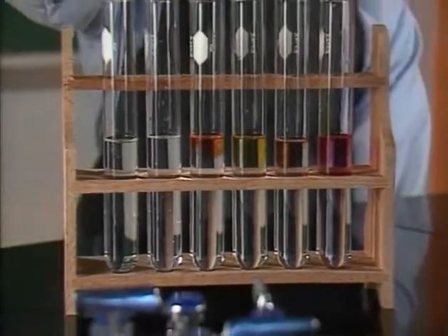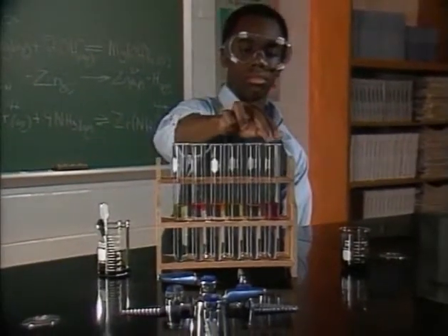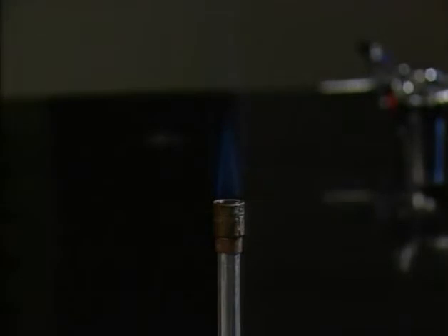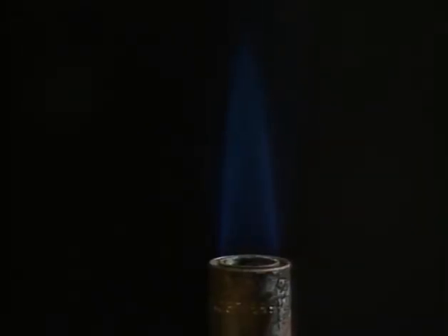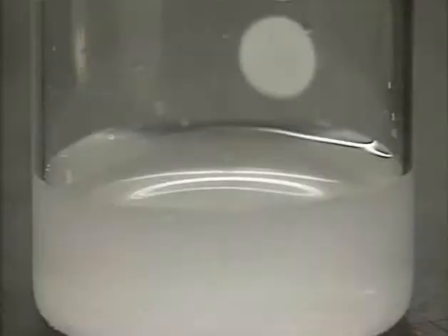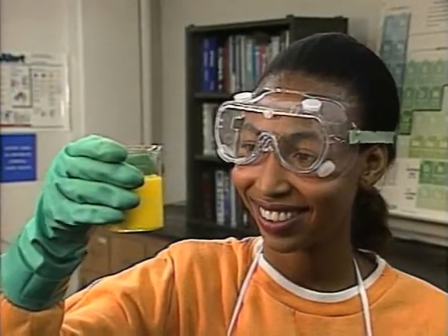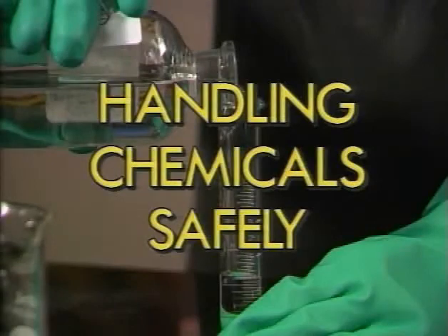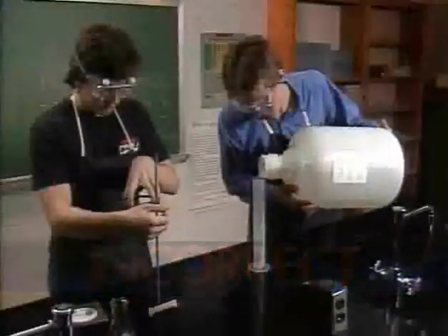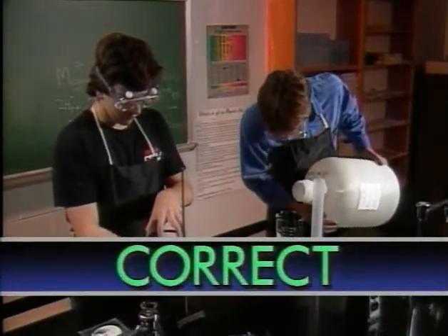A chemistry lab is different from most other courses — here you gain new knowledge by doing things, not just reading about them. You'll spend much of your time working with equipment and techniques that are new to you. They can be dangerous if you don't adhere to strict safety procedures, but if you start with safety by following the rules, paying attention, and using common sense, you can work with confidence.